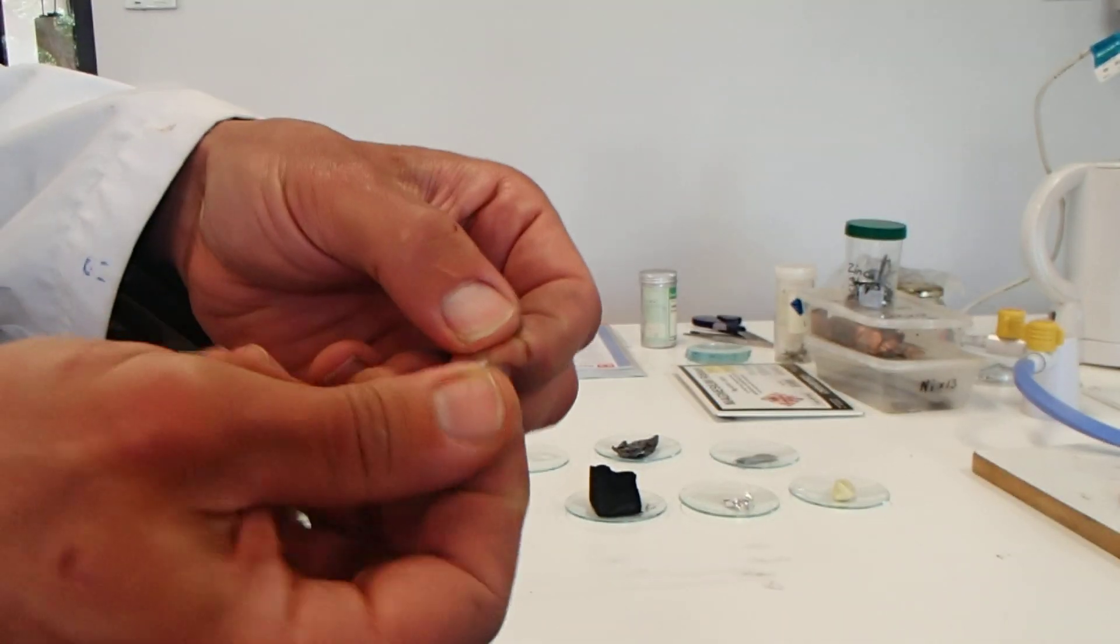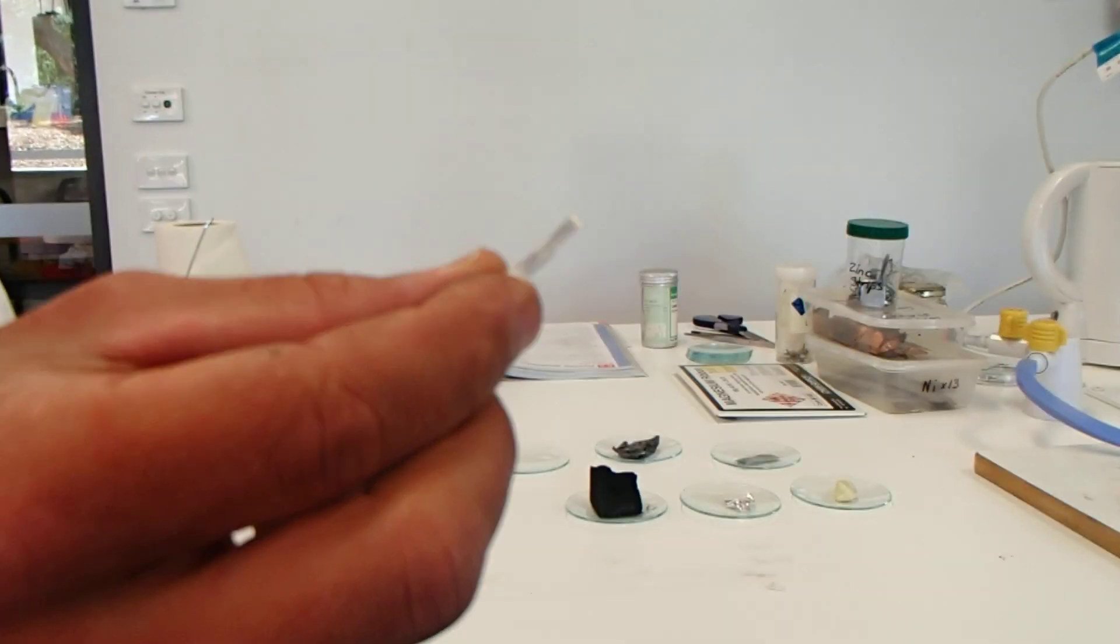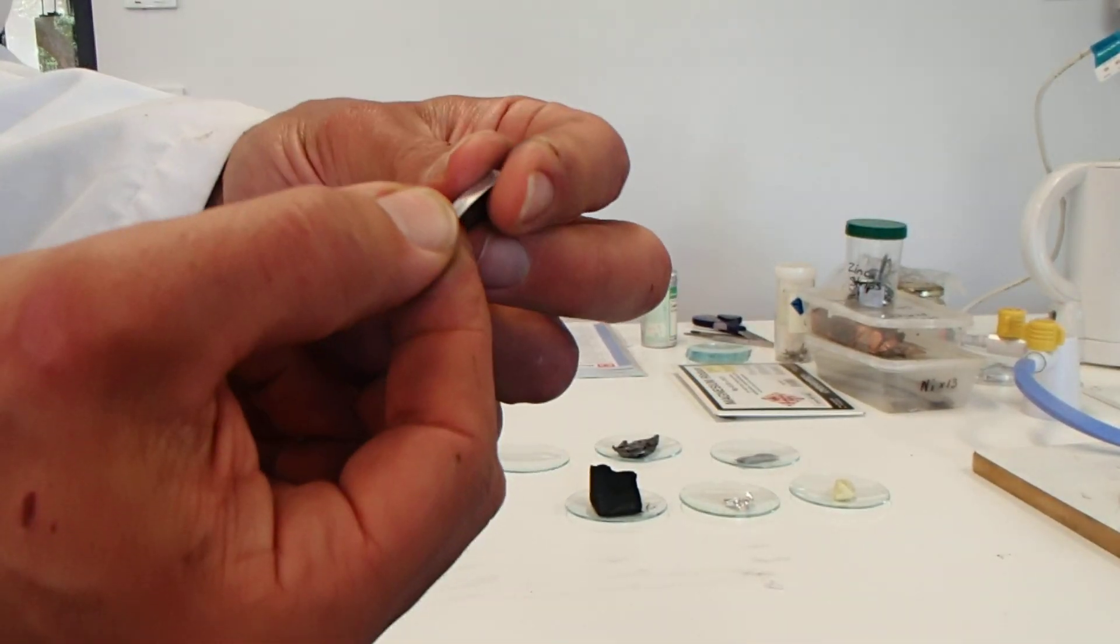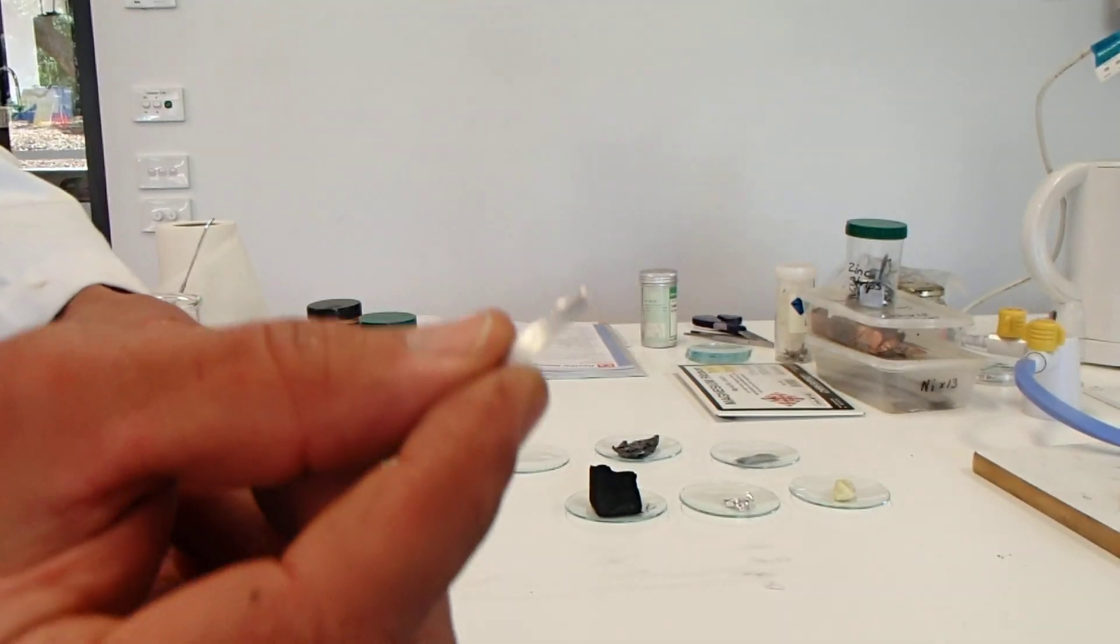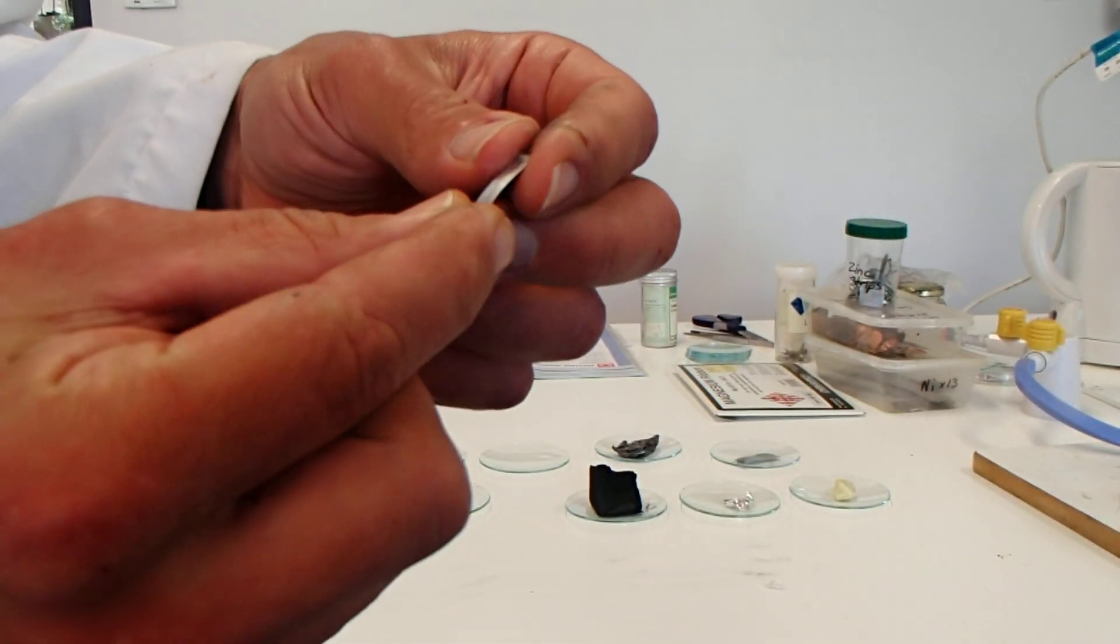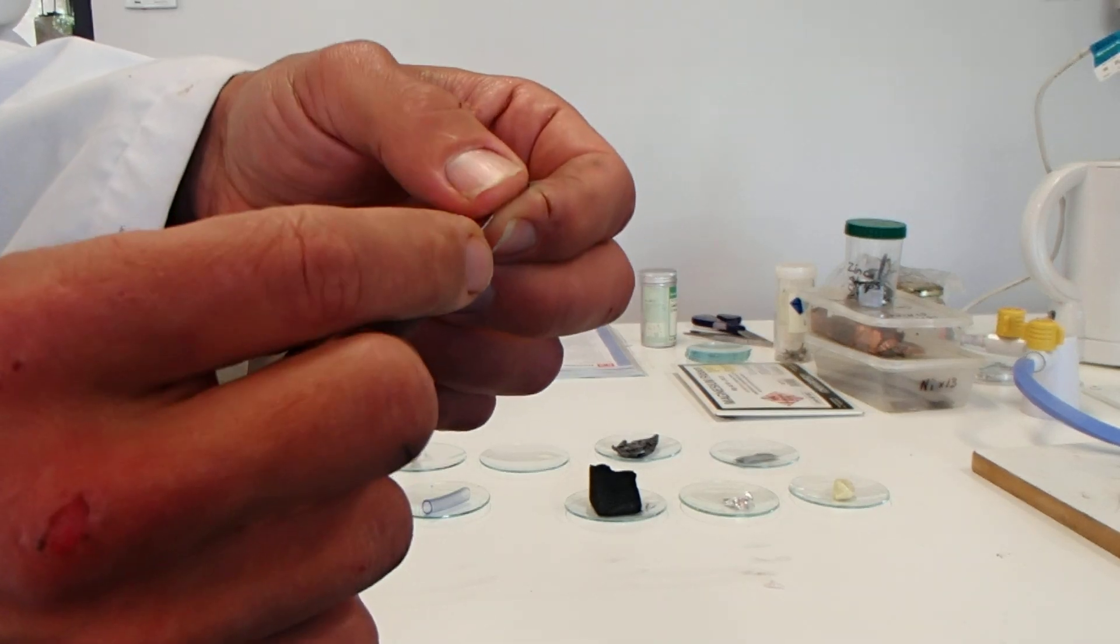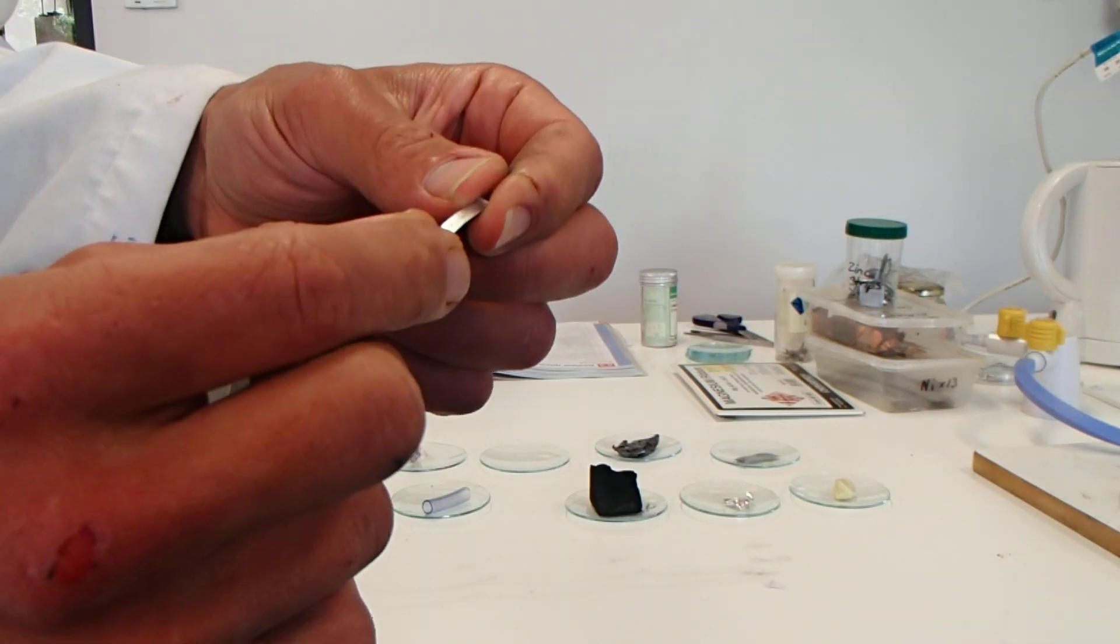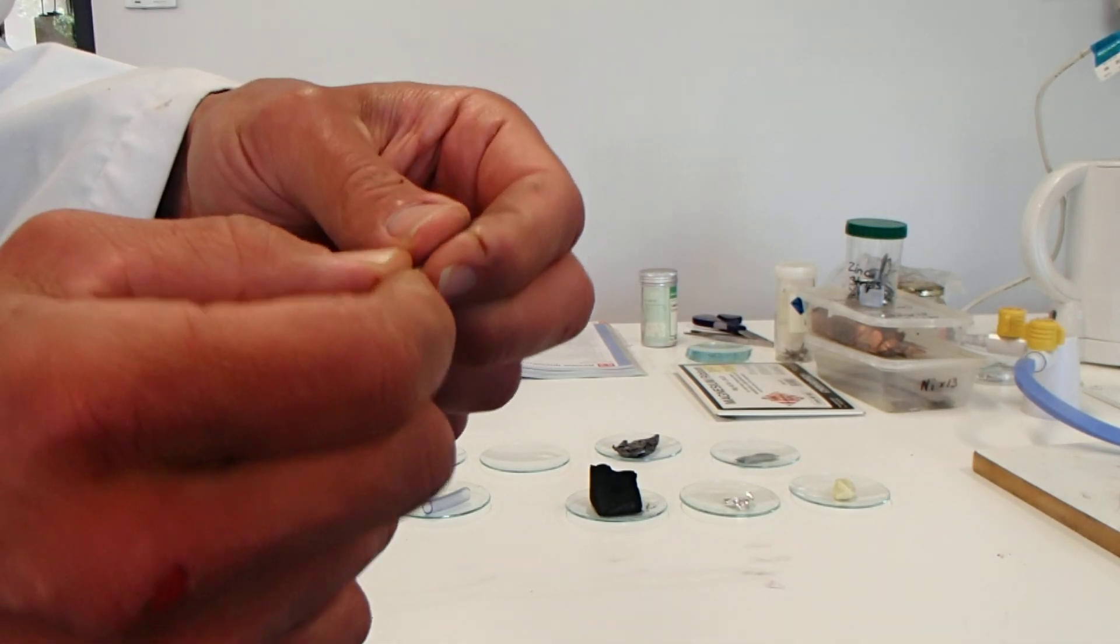Magnesium—fairly shiny, silver color again, quite light in its weight, looking like a typical metal. You should be recording these in the appearance part of your table. Magnesium, shiny, silver, not super shiny, not much texture, quite smooth.